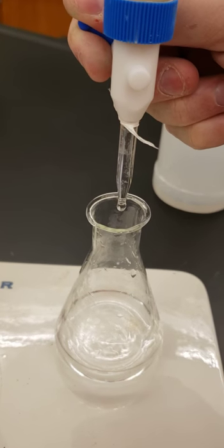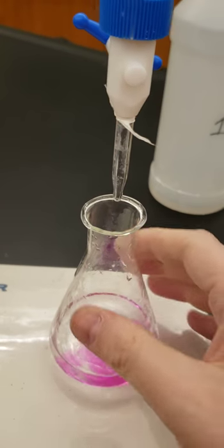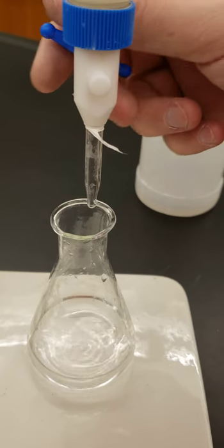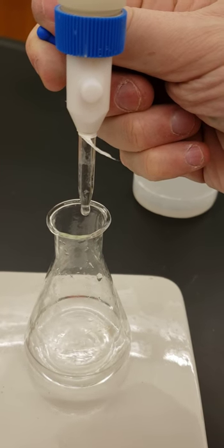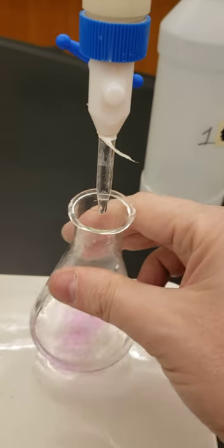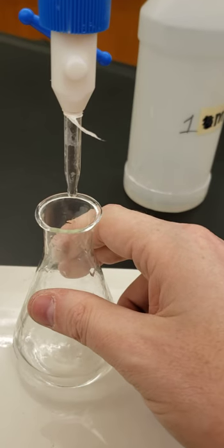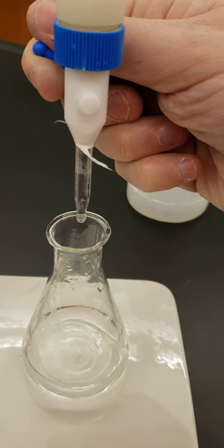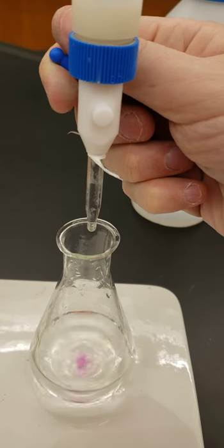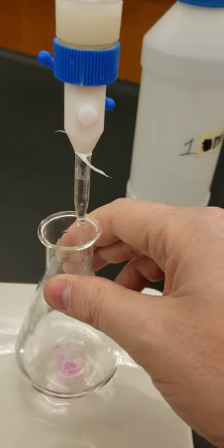Let's go a little bit faster for a second — it's always a challenge. Whoopsie, that was not good. Phew, lucked out, didn't overshoot it. Getting close — this is a lot easier when I'm not staring through a camera.